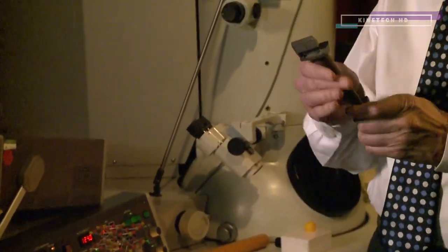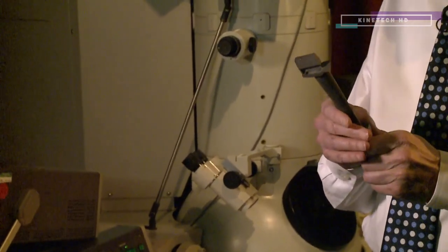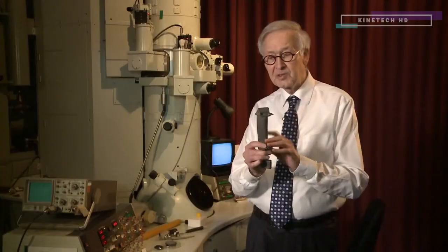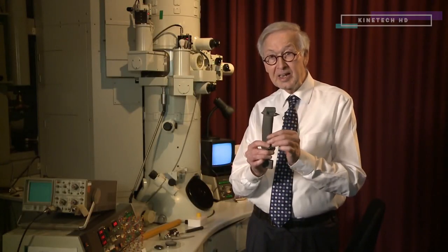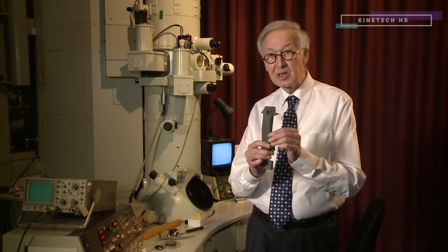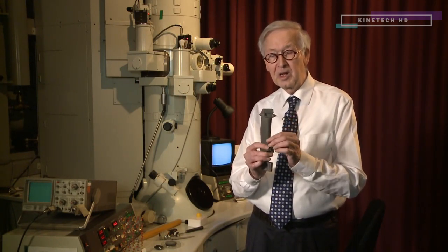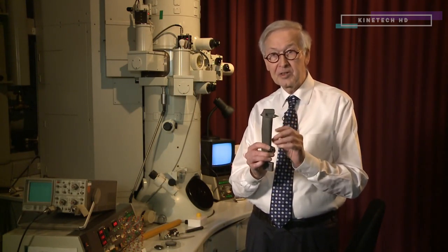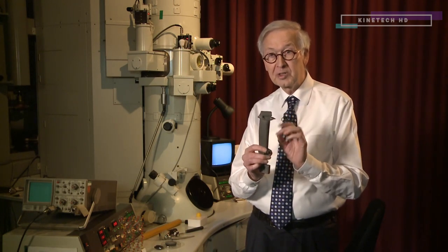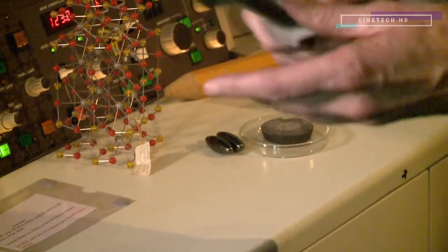For example, this turbine blade which is in an aerospace engine — it's the hottest point of the engine — it contains 18 different elements. We know where these elements are because of the electron microscope, and without the electron microscope we just wouldn't know where all these elements are and where the defects in those materials are as well.